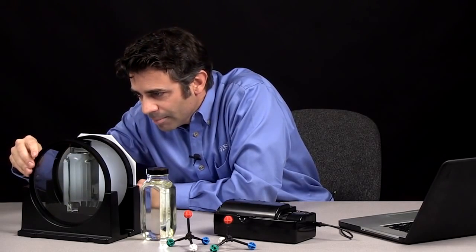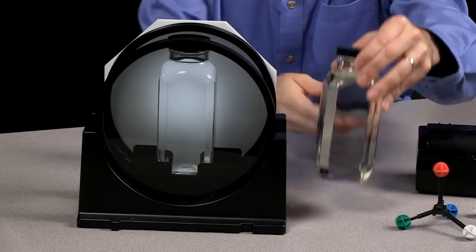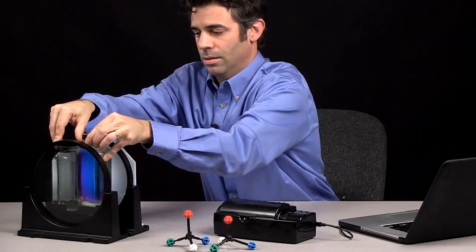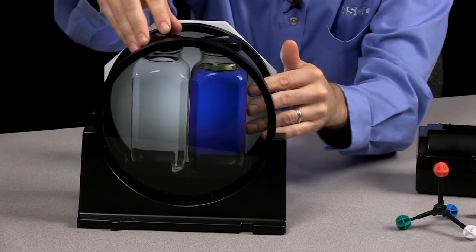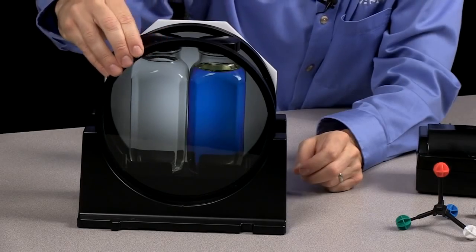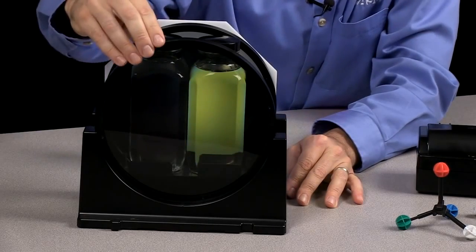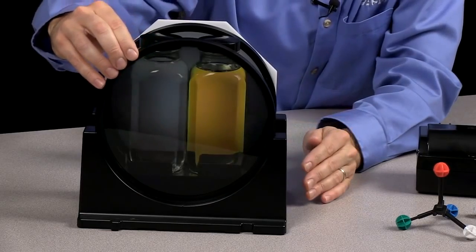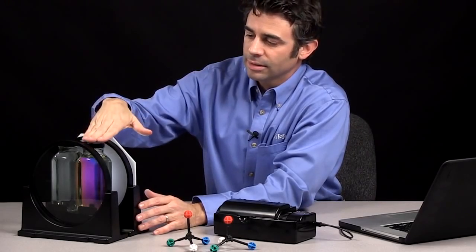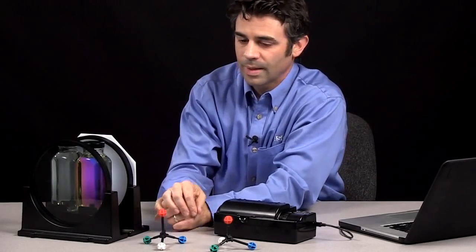But if I take that same light and I run it through a sample with a chiral center, in this case Karo syrup, then you'll notice that in this case some wavelengths of light are getting blocked while others are getting through. So now, as this is getting darker, this is getting brighter, different colors are starting to appear because of the different wavelengths of light that are being blocked or let through by that particular sample. So that's what I mean by rotation of plane polarized light. This is rotating the light, this is not, because there are chiral centers in the compound.